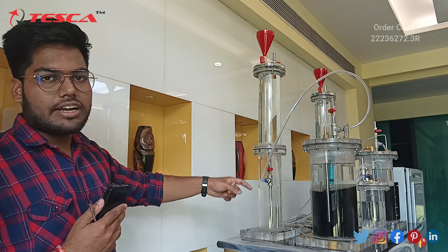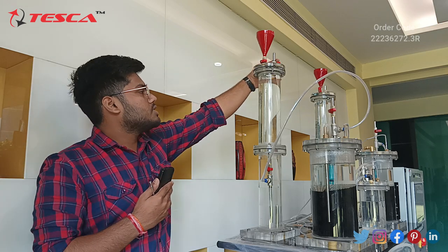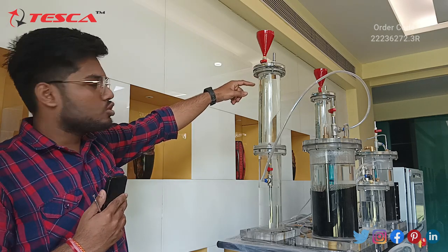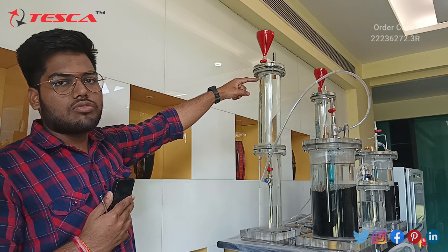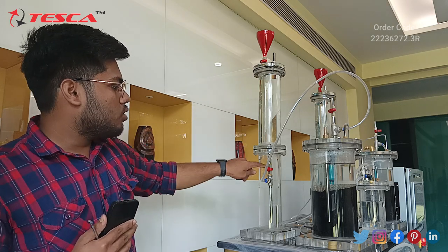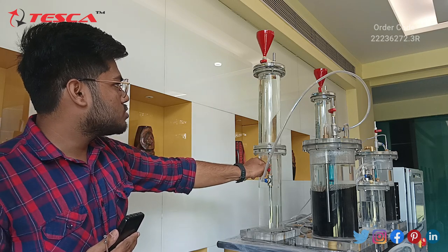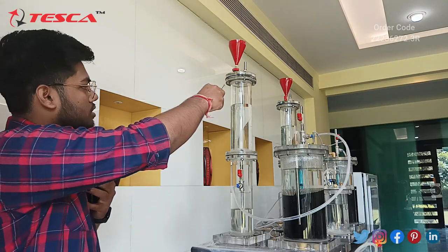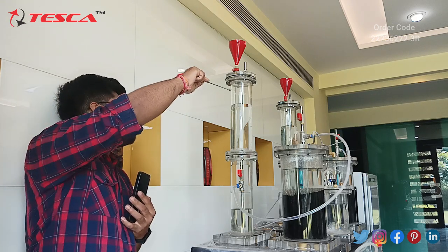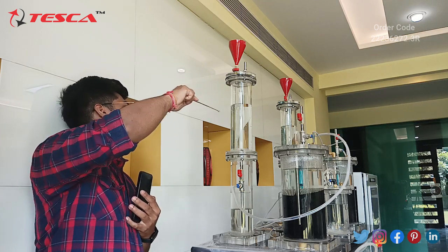Now we will open our gas valve so that gas is collected. Before that, make sure the funnel valve and air valve are both closed so that air cannot pass from above column 1. We will also take a measurement of the initial water level, which is at 27. Now I will open the gas valve from column 1 so that gas passes into this column. As we can see, the gas has filled in this gas collecting tank. Our first reading was 27 when water was full, and after the gas entered, our reading is 18.5.